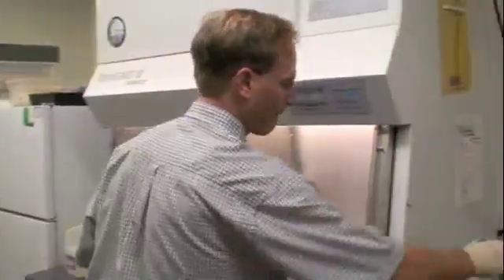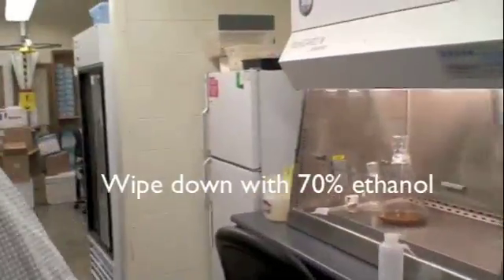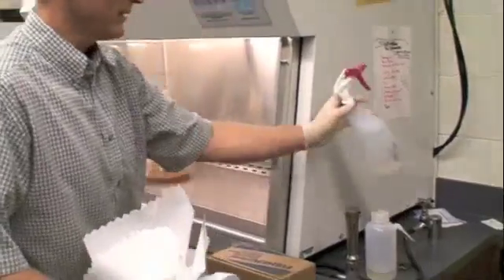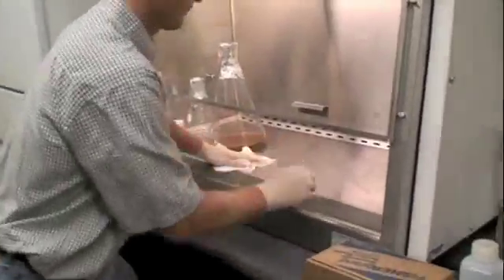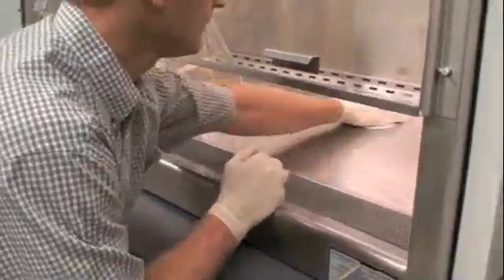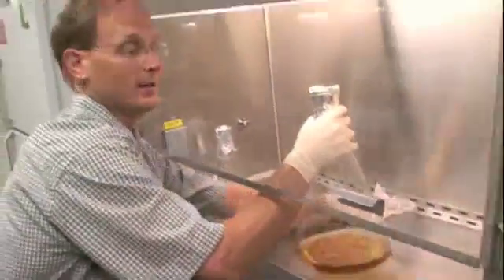Before using it, we should wipe this down with 70% ethanol. You never know who the last person was that used it, but this is a nice spray, so we'll spray down before we even begin, so we know that it's clean.